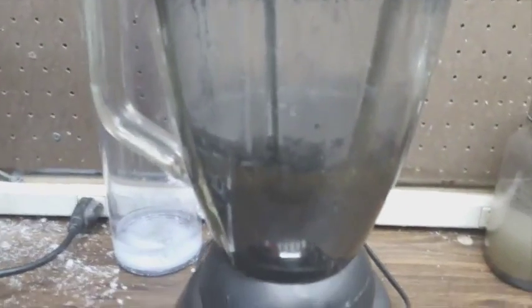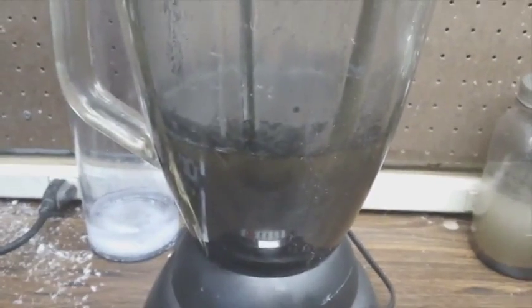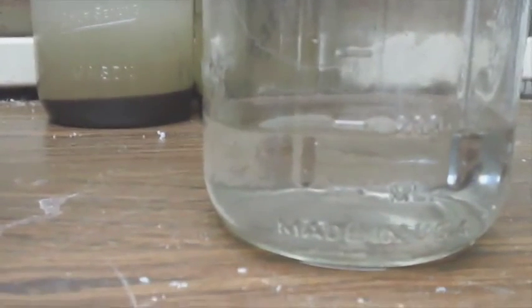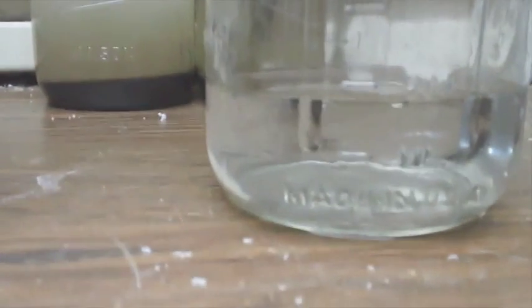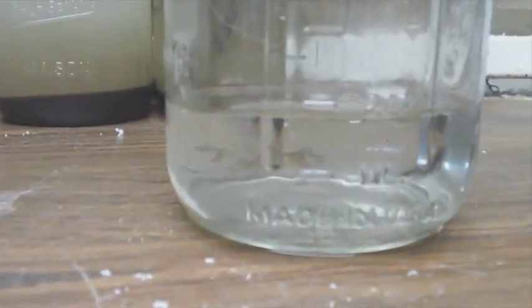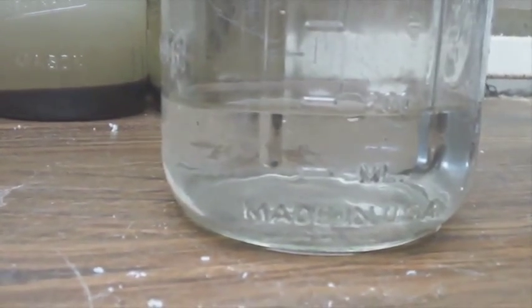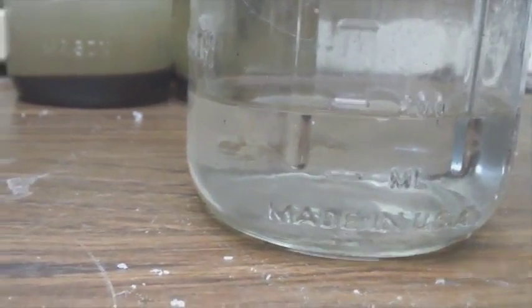It's running at about 149-150 degrees, so it could be just the heat. I'm running it to where I'm getting about 200 milliliters of the acetone back through the condenser, and that's where I'm stopping it. It's pretty dense and does tend to climb up the wall.